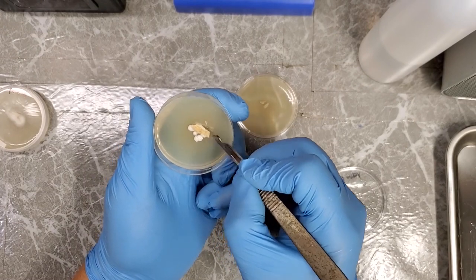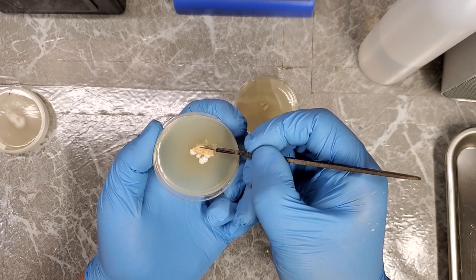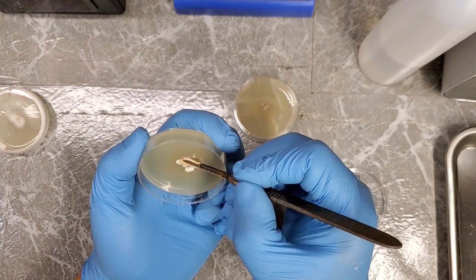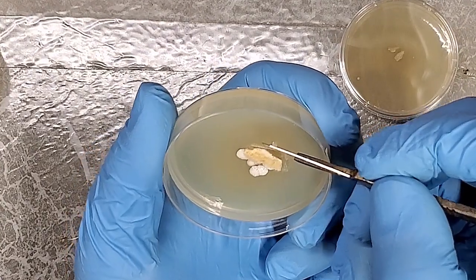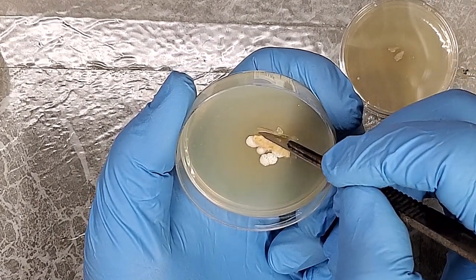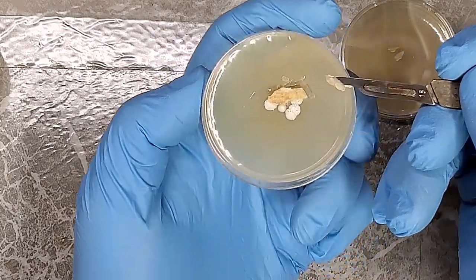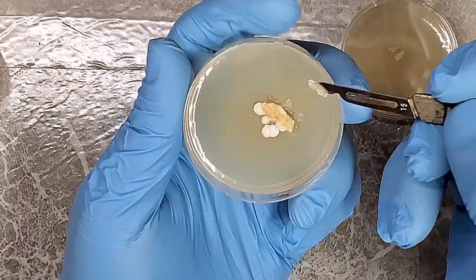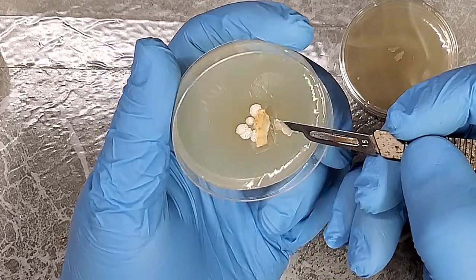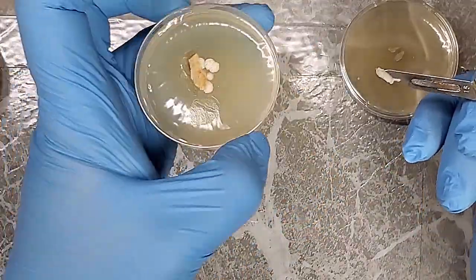Once again, we're just going to ignore all this stuff. We'll do one more faux transfer. Let's say that this part right here is the only area that we had good growth on that's not contaminated. So if you really wanted to, you could just do this. Almost just scoop that good piece out of there. And be sure, while you're scooping, not to accidentally drop it. I've done this before. Don't drop it in the contamination, for one. But two, don't accidentally graze the contamination or anything like that, okay?